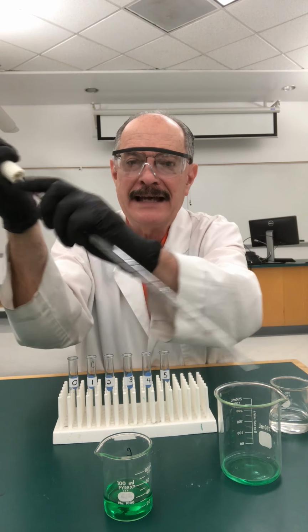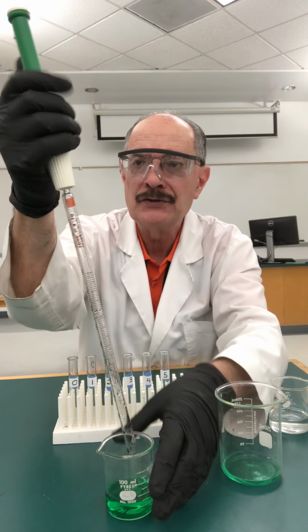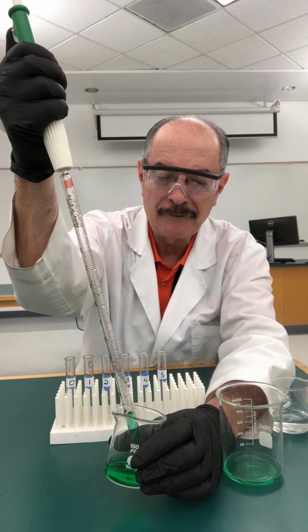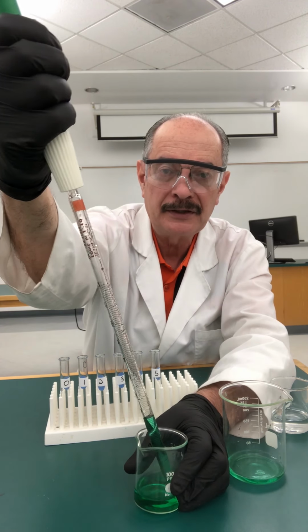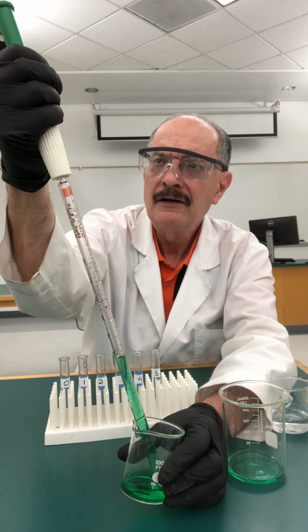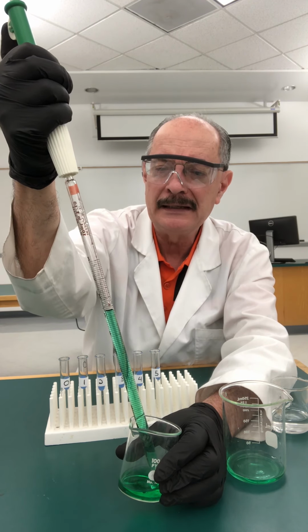I'm going to attach it to the top, make sure that it's tightly sealed, and then I'm going to dip it again into my solution, and I'm going to draw up a bunch of the liquid into the pipette. Again, be careful because, like I said, there's a little drag between turning the wheel up here and the liquid actually going in. And depending on the width and the length of the pipette, you might be able to fill it up completely, you might not.